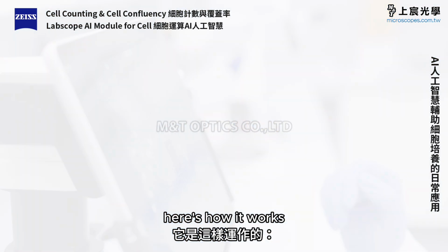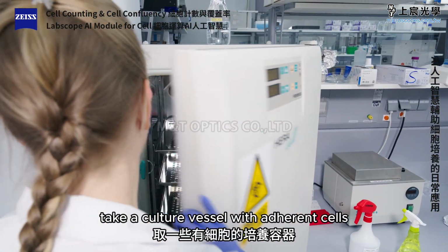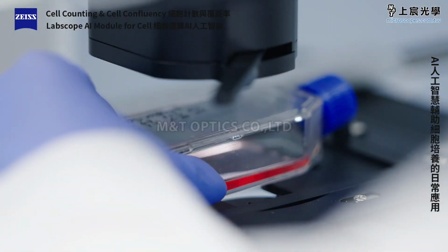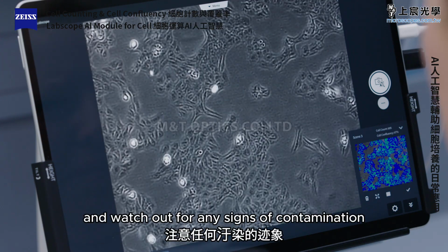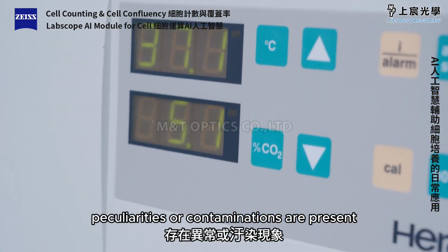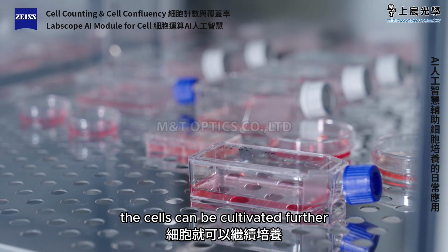Here's how it works. Take a culture vessel with adherent cells out of the incubator and observe its condition with an inverted phase contrast microscope. Check the medium daily and watch out for any signs of contamination. If no morphological peculiarities or contaminations are present, the cells can be cultivated further.